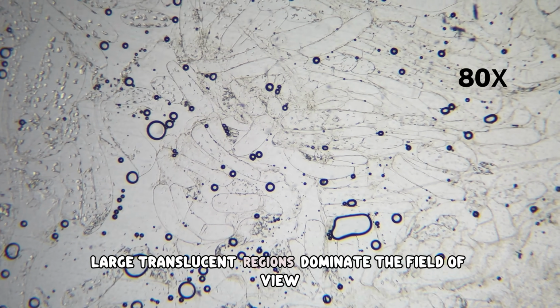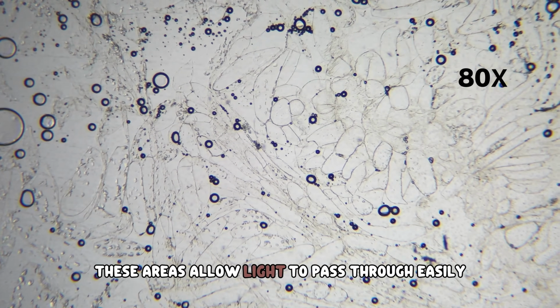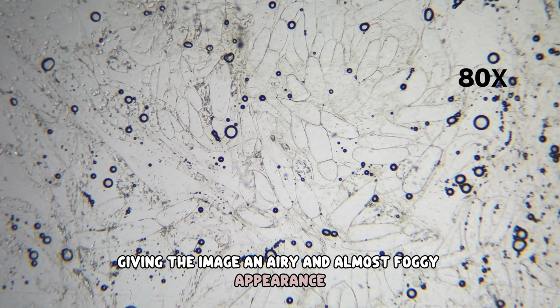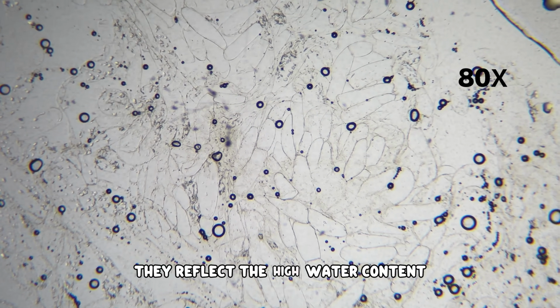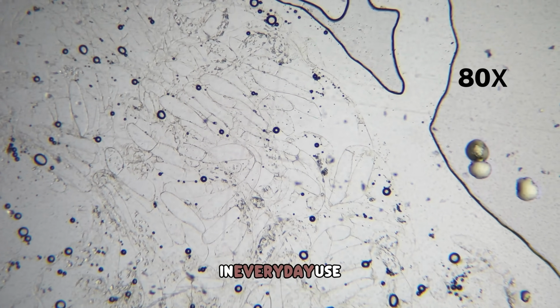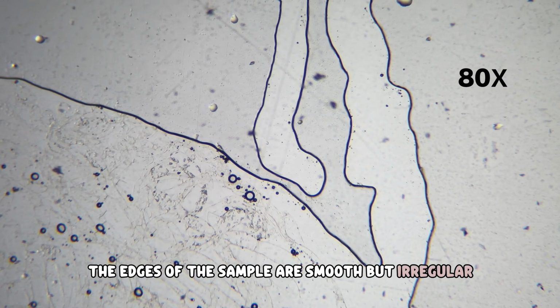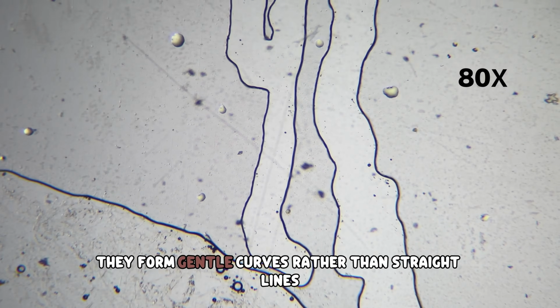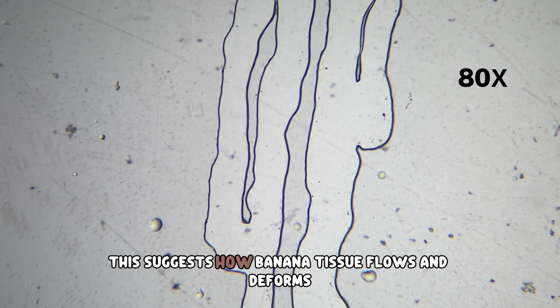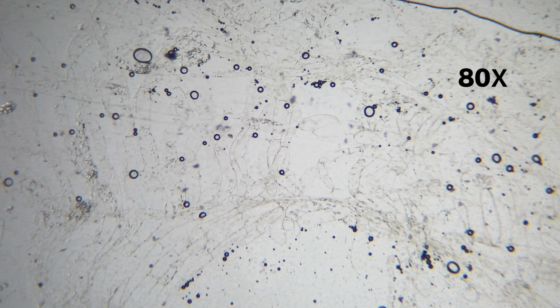Large translucent regions dominate the field of view. These areas allow light to pass through easily, giving the image an airy and almost foggy appearance. They reflect the high water content that defines the banana's soft texture in everyday use. The edges of the sample are smooth but irregular. They form gentle curves rather than straight lines. This suggests how banana tissue flows and deforms under even slight pressure.